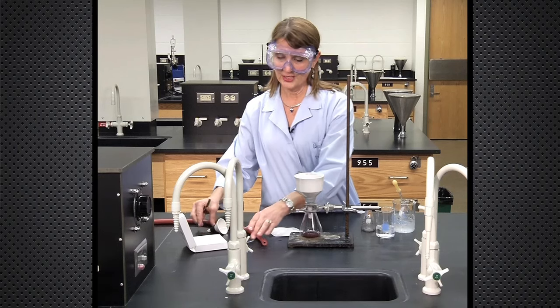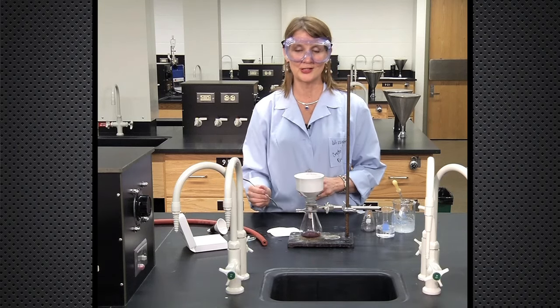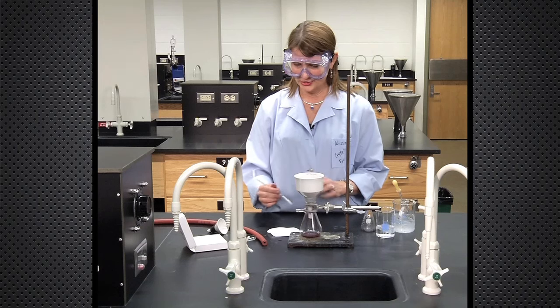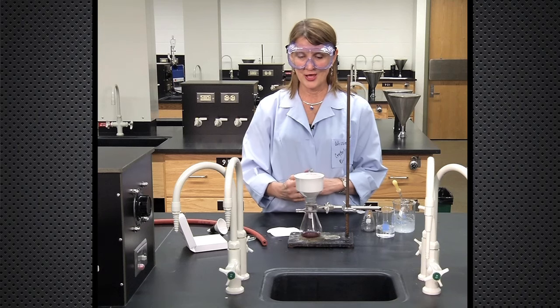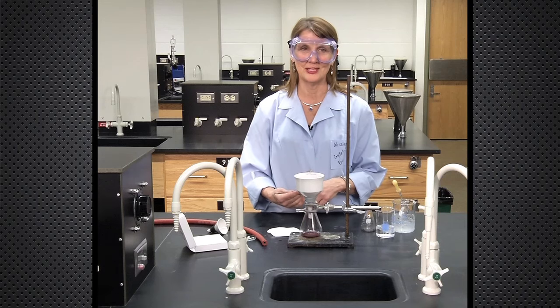Then you can carefully transfer the crystals to a watch glass or into a vial for massing or determining the yield.